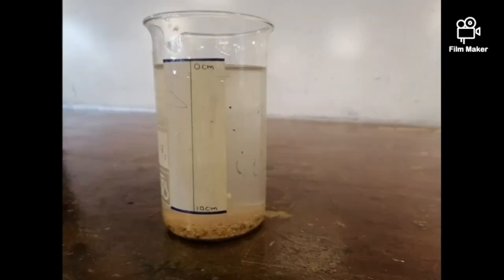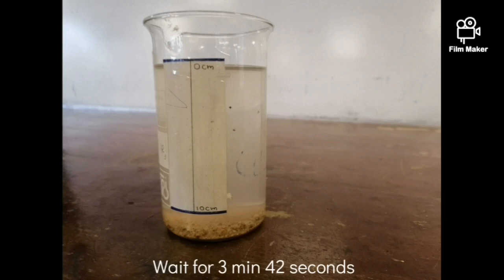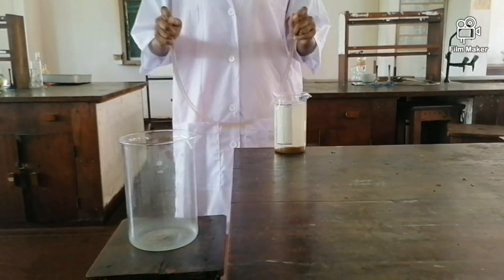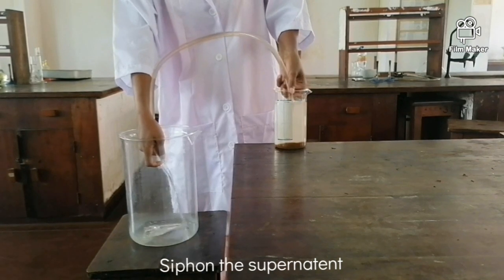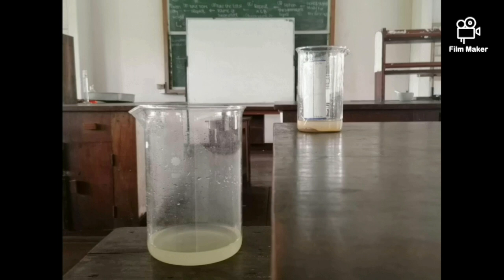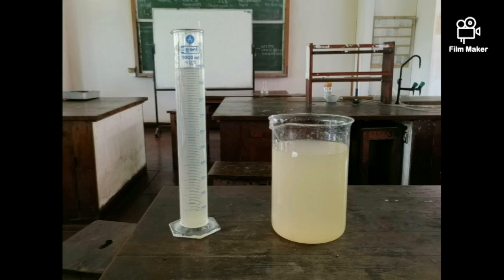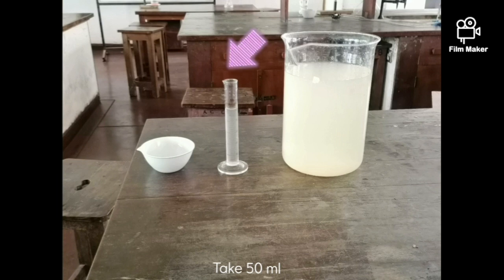Now repeat the siphoning process for silt. Allow the mixture to settle for a period of 3 minutes and 42 seconds, then siphon the supernatant liquid from the 600 ml tall beaker without disturbing the sediment. Measure the total silt aliquot volume using a 1-litre measuring cylinder, then take 50 ml from the aliquot and transfer it into an evaporating dish.